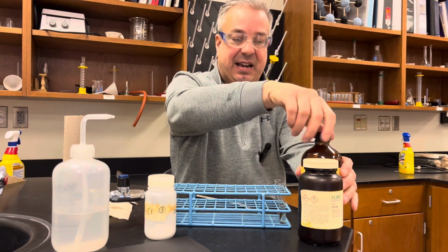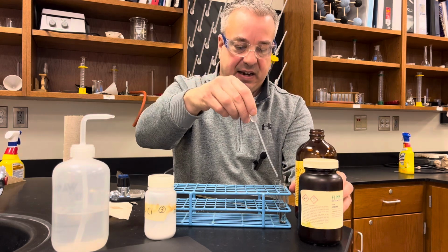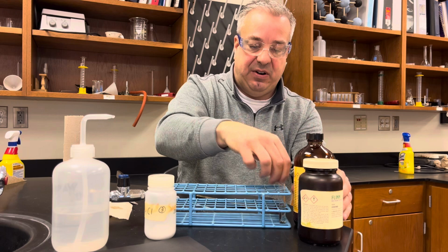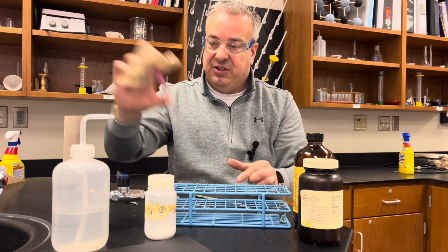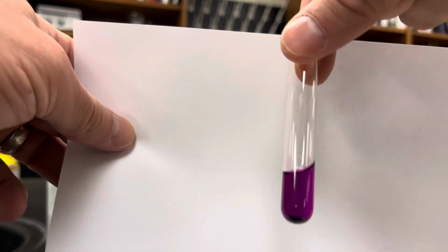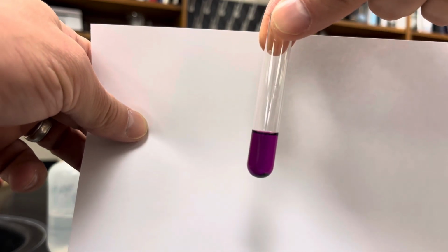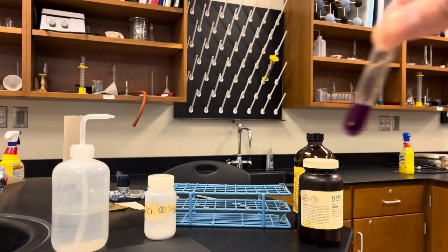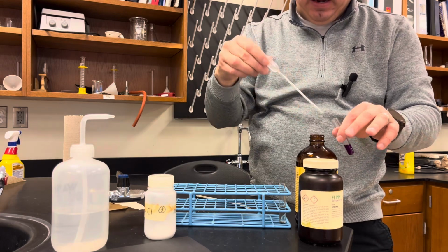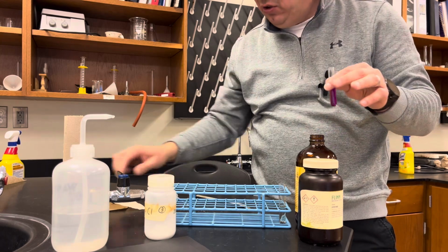But if we use a nonpolar solvent like hexane, we'll see if it dissolves in the hexane. So our second test tube is right there. And as you can see, we already got a nice purple color, but we'll shake it up still. And you can already see, because of the purple solution, that the iodine is dissolved in the hexane. We get this nice purple solution instead. There are a little bit of iodine crystals at the bottom. I have a feeling that it just needs a little bit more time to dissolve, or maybe we need a little bit more of the solvent to get all that iodine to dissolve.